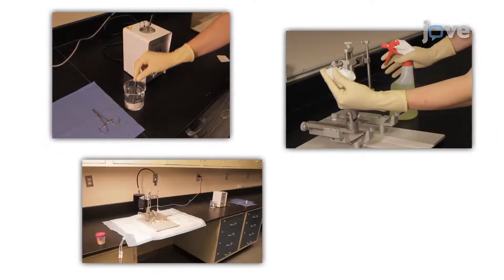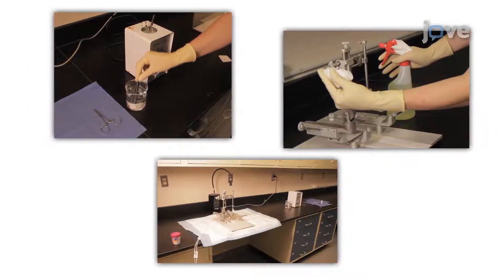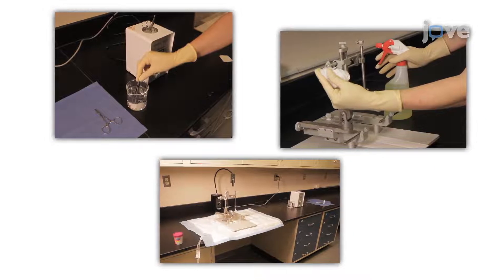Next, the correct preparation of the work area that will allow for a smooth workflow and maintenance of the sterile field is demonstrated.